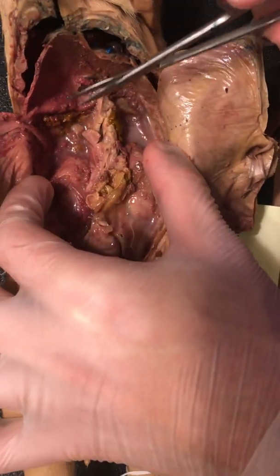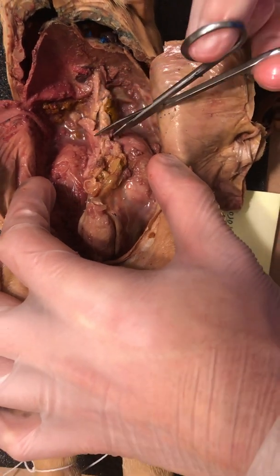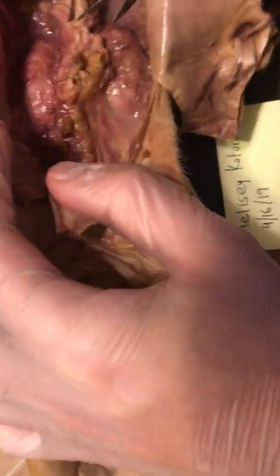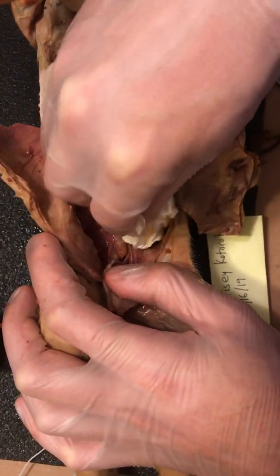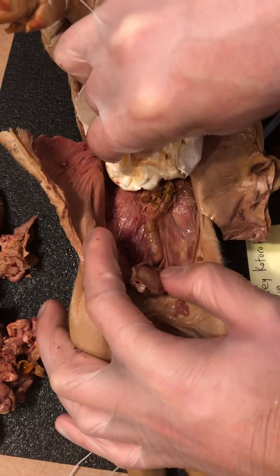Do we have a napkin or something? No, I need something dry to soak up all these juices settling at the bottom. Tissue to soak up some of the juices that have accumulated at the bottom. They were kind of getting in the way, so.